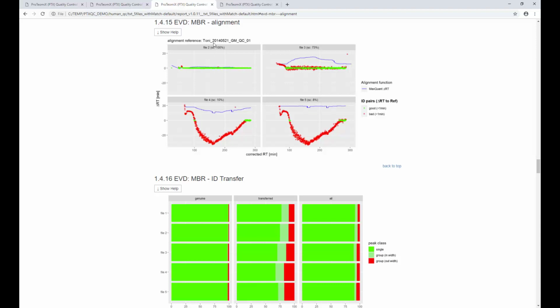Now, that's the case for the second file. For the third file, it doesn't really look that nice. Apparently 73% of all the dots are green, the rest is red, so questionable. But then in files 4 and 5 it gets even worse. We can see something which is intriguing. What you see here, basically the delta compared to our reference for identical peptides, is up to, what is this here, 30 minutes.